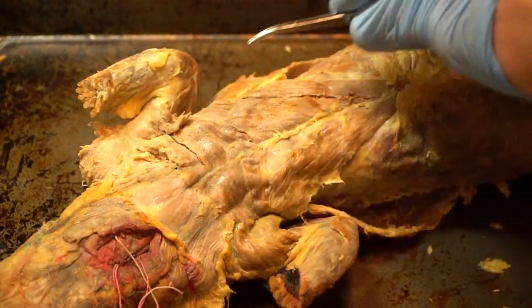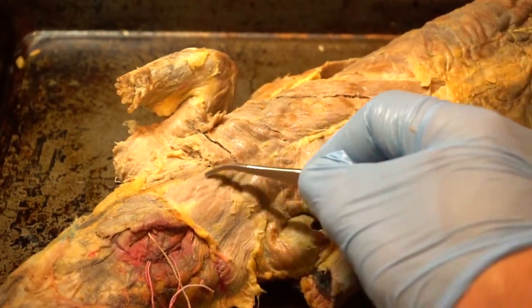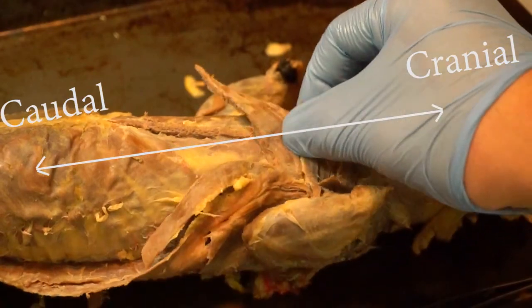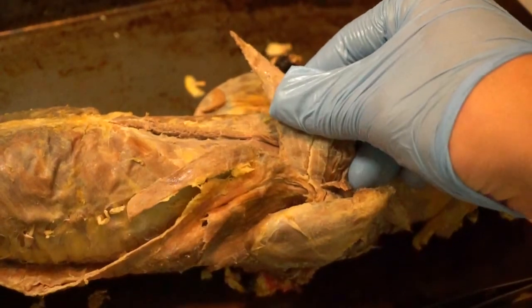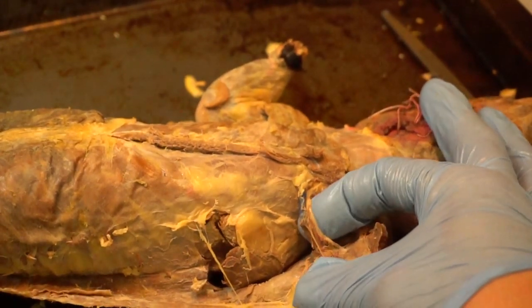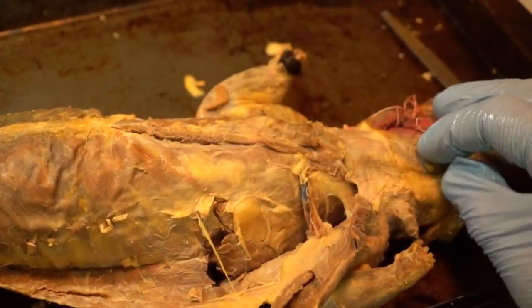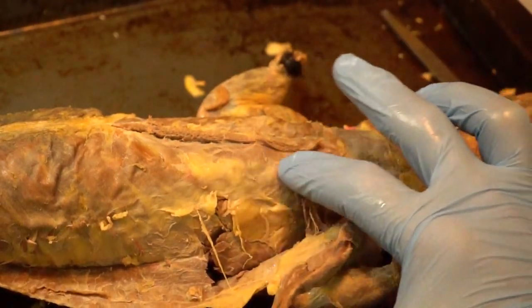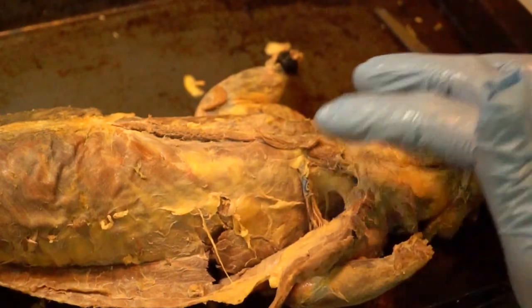The next step is to go deeper into the thoracic on the ventral side. To do that I'm going to reflect the pectoral muscles at the midline — reflect them that way. I've reflected all the pectoralis muscles by cutting them and reflecting them this way. Before getting into the deeper muscles, I want to show you what to expect when you cut the pectoralis muscles out of the way. You're going to see a lot of fat and fascia that needs to be cleaned up. Also you're going to see the ulnar nerve right here — if you see the ulnar nerve, you know you're in the right area.